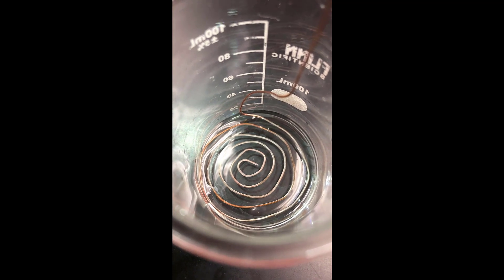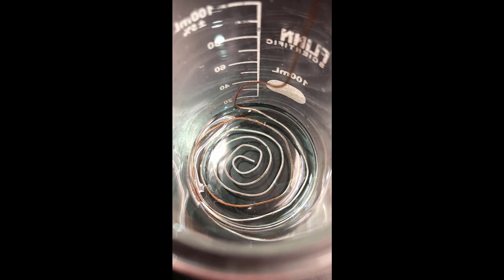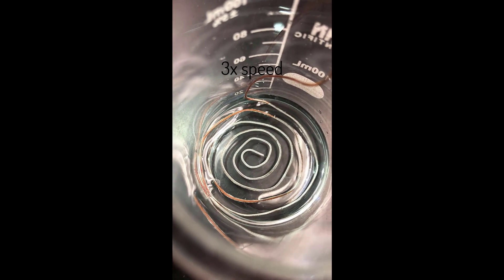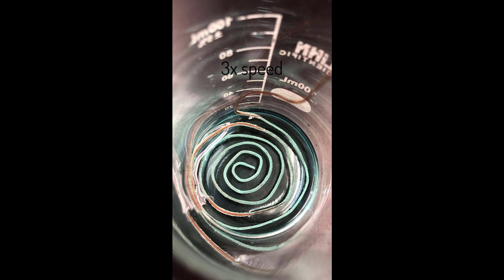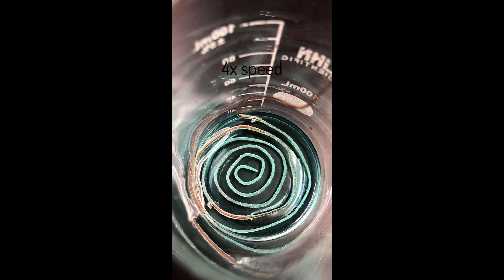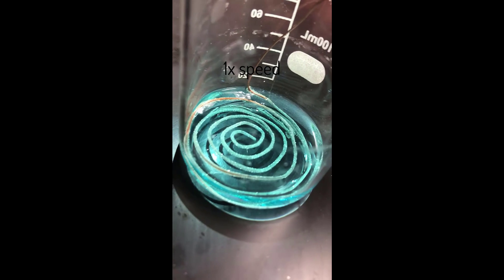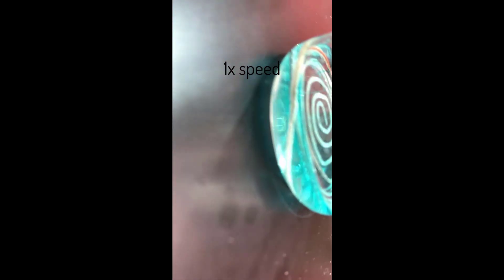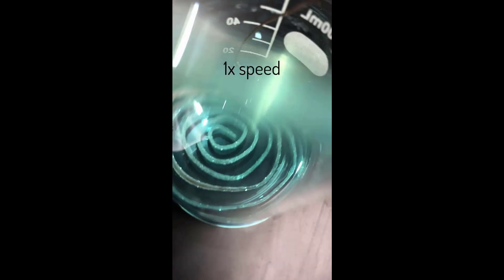Why don't you lift your light up a little bit more on top — yeah, not too much on top, yeah. This is a good one, very clear now, I will see you. This is a good one. Ooh, it's getting nice and sparkly.